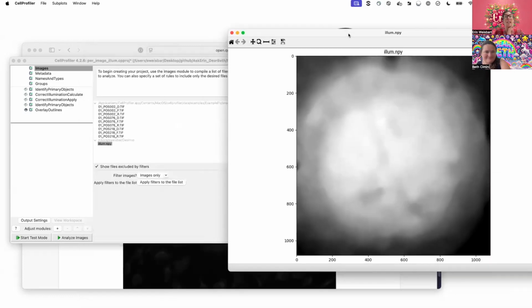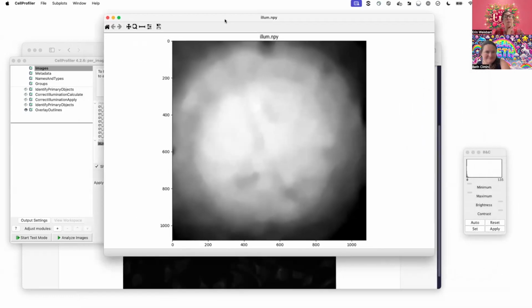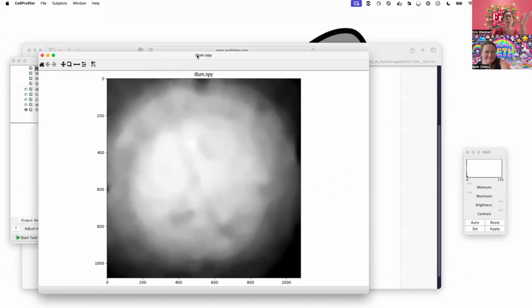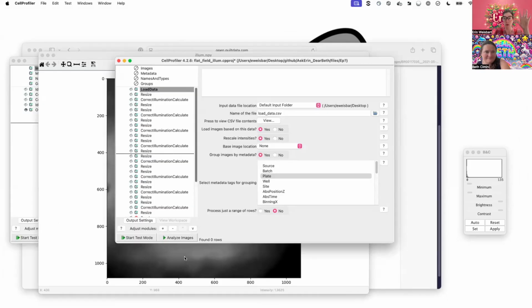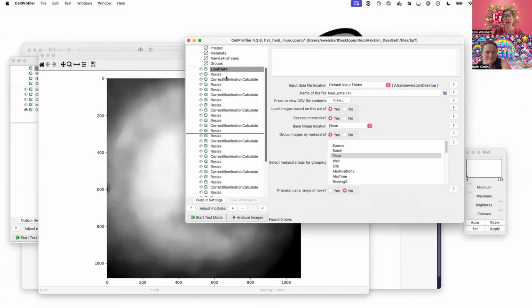So the pipeline that I'm showing you here just creates those flat field illumination correction files. They would then be applied to the images in a separate pipeline. So that is one difference between this and the other method I'm going to show you, the other way of doing corrections. Note that this is just creating them. It is not actually applying them.